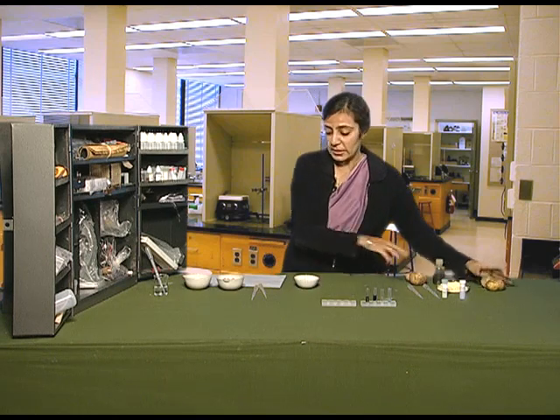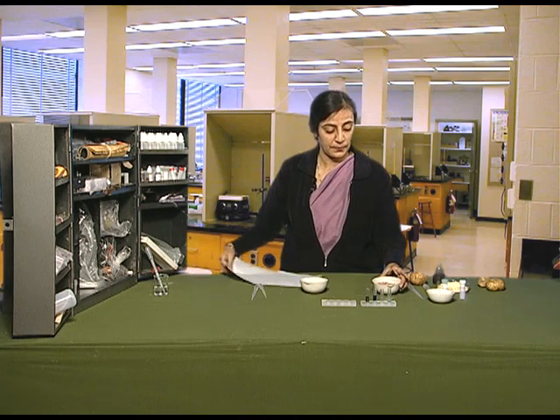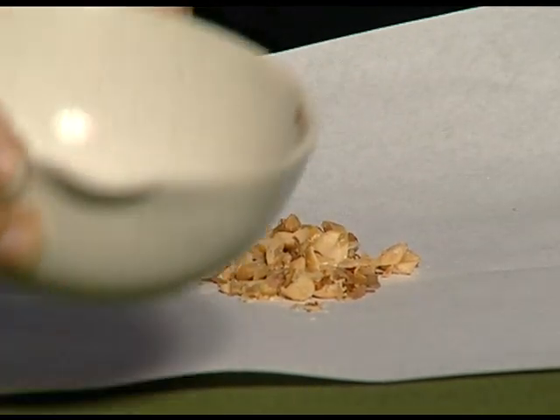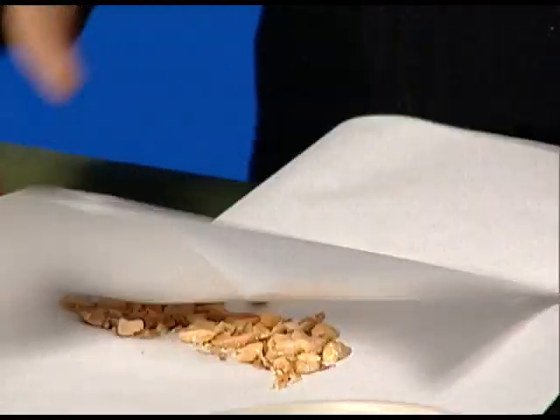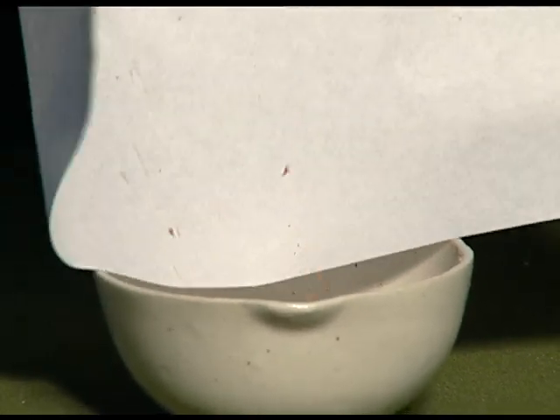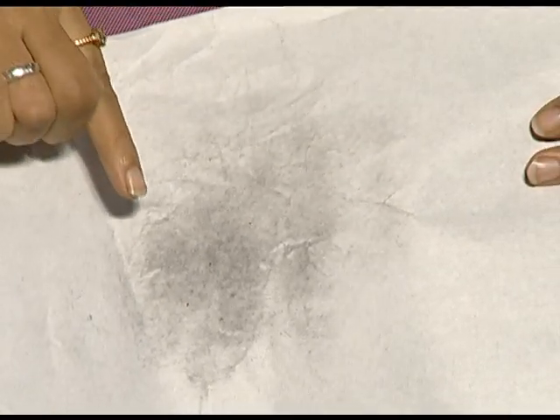Now we will test whether fats are also present in our food material. To test the presence of fats, we need groundnut and paper. We crush the groundnuts, then put them on the paper and slowly press or rub them. Now we add the groundnuts back into the china dish.